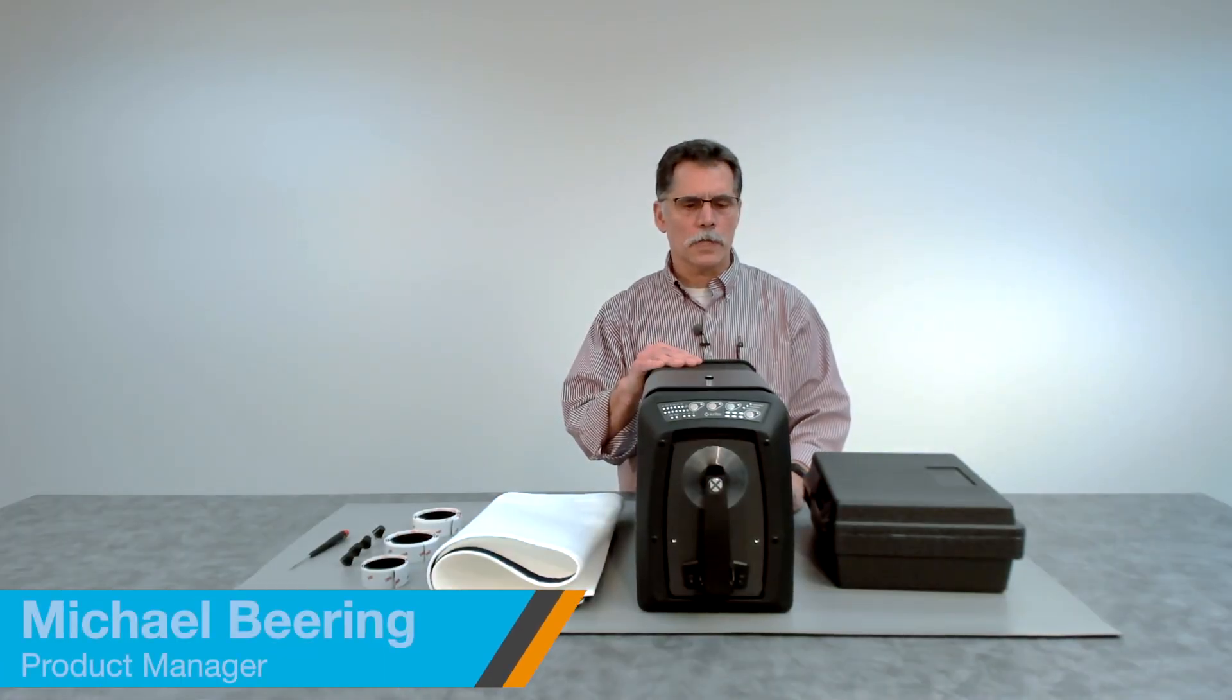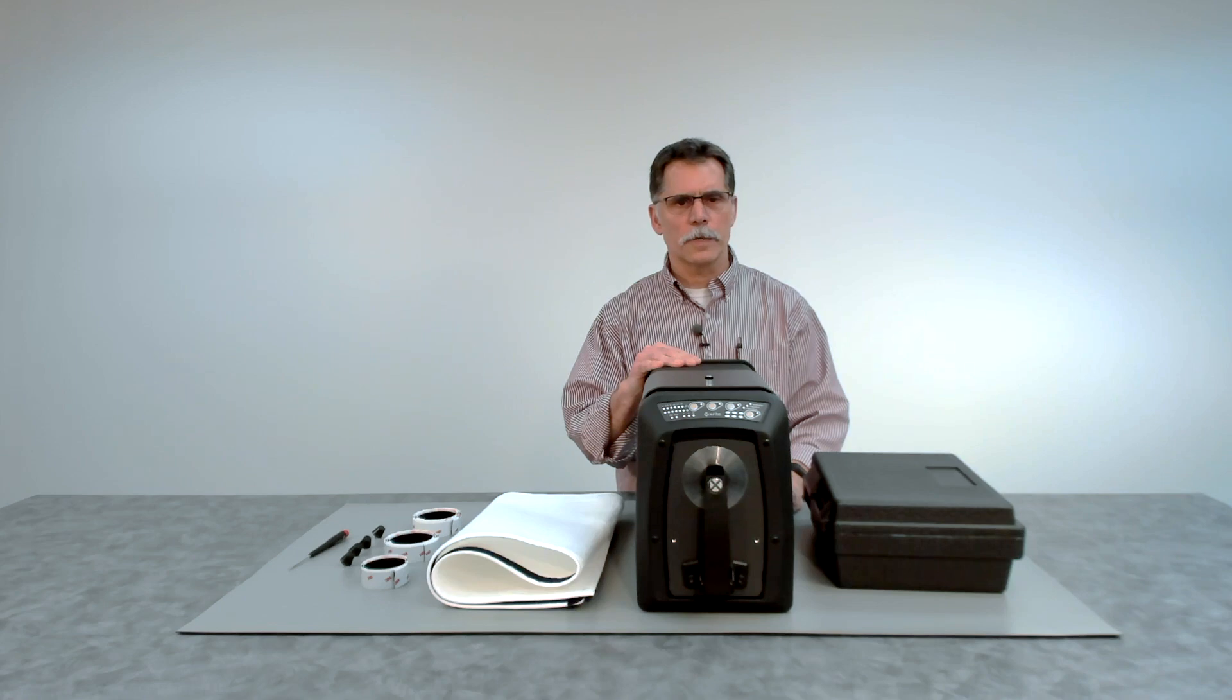When spectrophotometers are installed in a less than ideal environment, such as those with high airborne dust contamination, that dust can have a negative impact on the instrument.